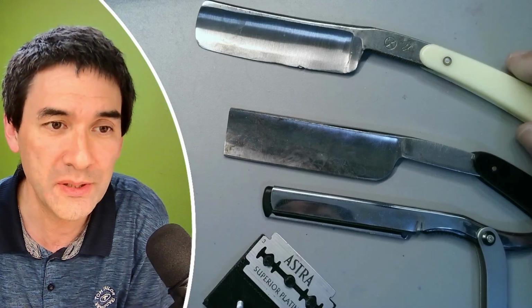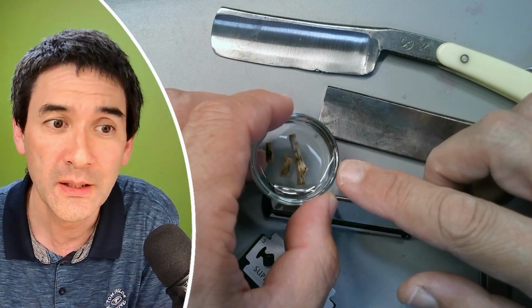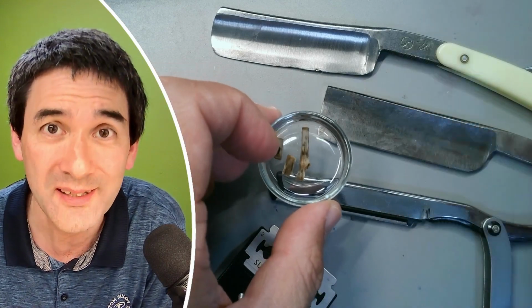And what I'd like to do is the following. I've got a piece of fairly hard oak wood over here, submersed in glycerin to soften it, and I would like to test now those four knives, and I would like to see which one is able to cut the wood best for microscopy.